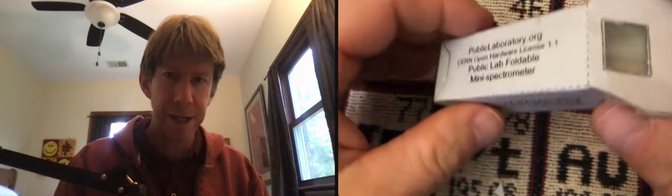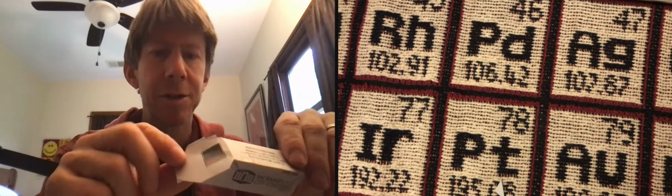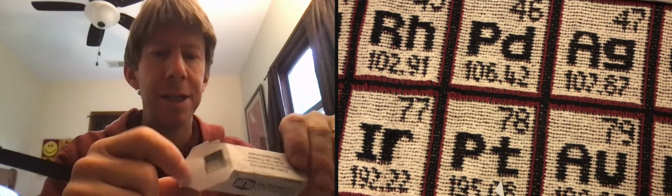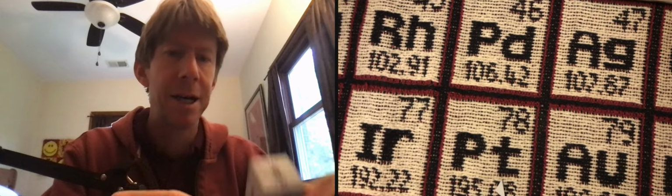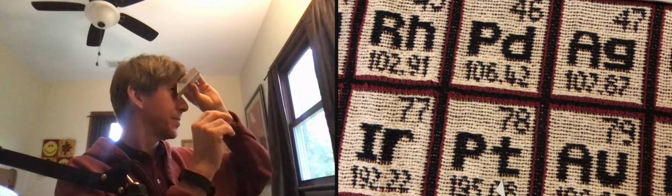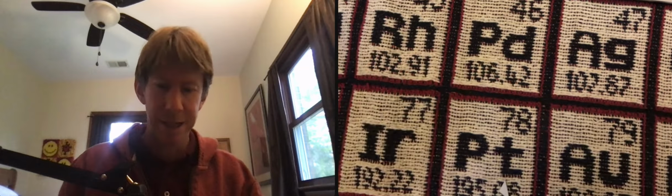And now I've got a spectrometer. It's got the diffraction grating, that piece of plastic that came in our kit, over this window right here. It's got nothing over this slit right here. And when I hold it up to a light, I should be able to, I don't know if I can show this. That's going to be hard. Oh yeah.